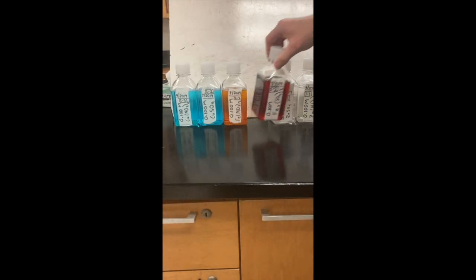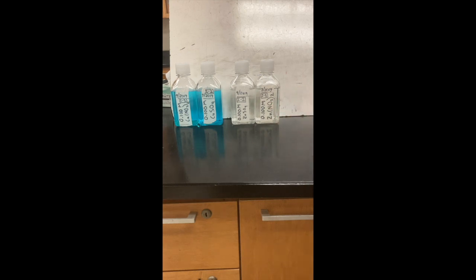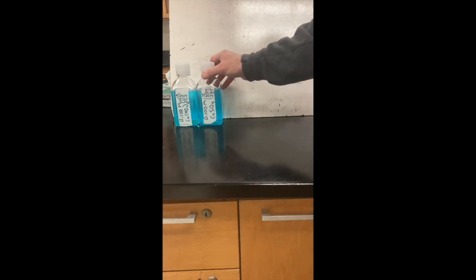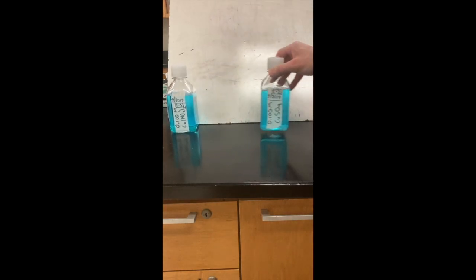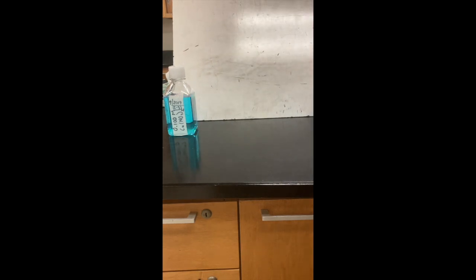So when you put that information together, the iron compounds' primary absorbing color is not useful because there's no iron in brass. If you have to choose between the bluish color and the colorless zinc solution, obviously the bluish copper-colored solution is what you want to analyze. So about 820-ish nanometers is probably the right way to go, because that's where copper ions seem to absorb, and that's going to be the primary color-producing ion.